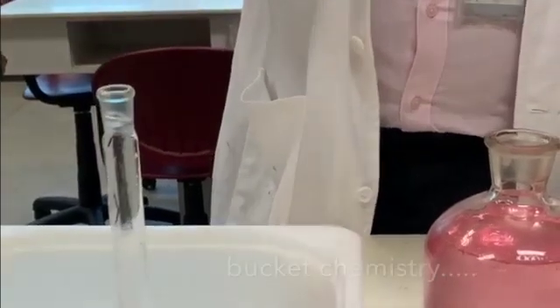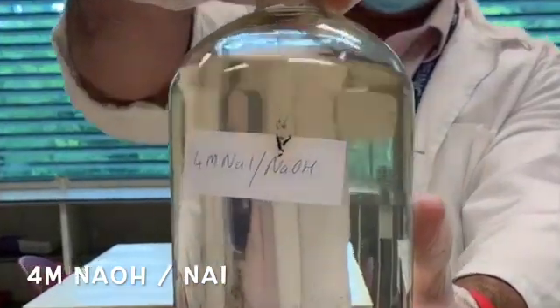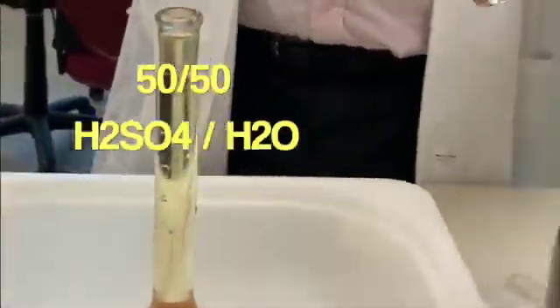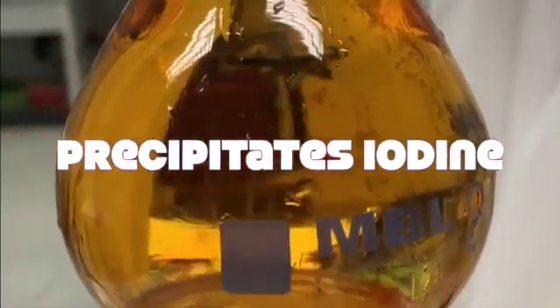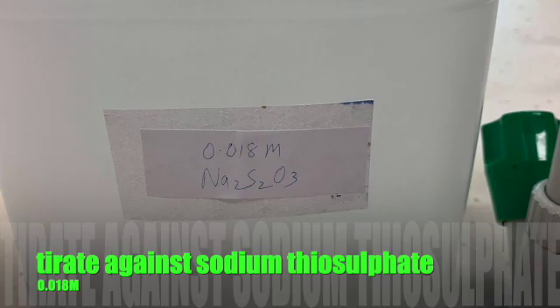Next step, we need to add some sodium iodide and sodium hydroxide to precipitate our manganese hydroxide Mn(OH)₂. Once that's precipitated, give it a good shake, then add some very strong acid - 50/50 volume for volume concentrated sulfuric acid with water. This gives this beautiful golden iodine which we titrate.